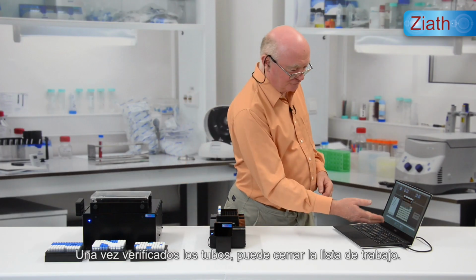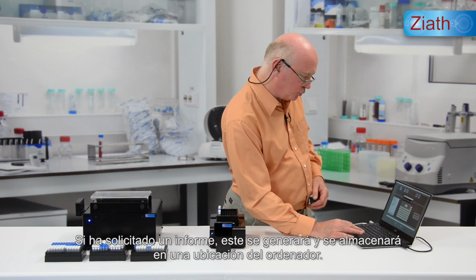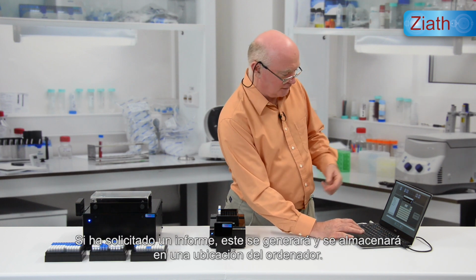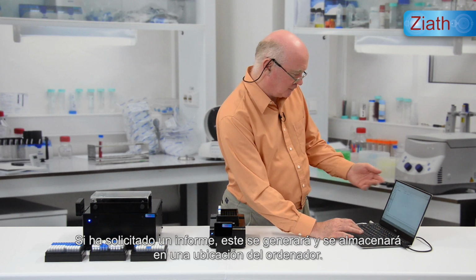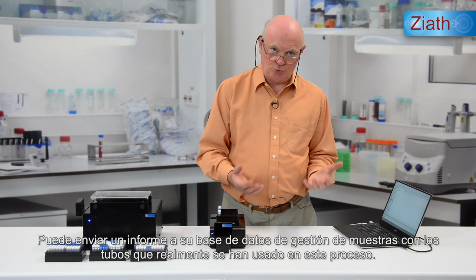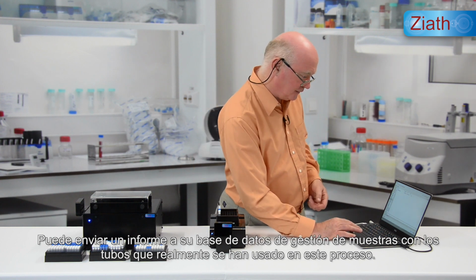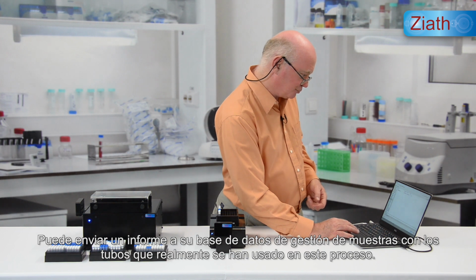Once the tubes have been verified, the work list can be closed, and if you've asked for a report, that will then be generated and stored in a location on the computer so that you can verify or import to your sample management database the tubes which have actually been used in this process.